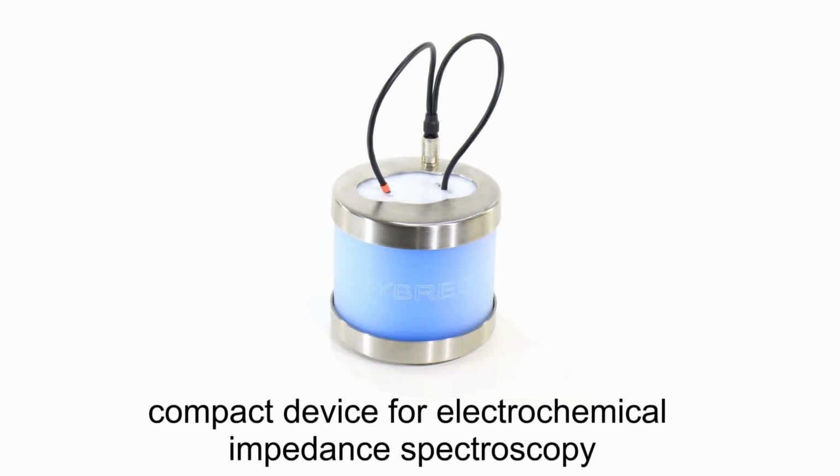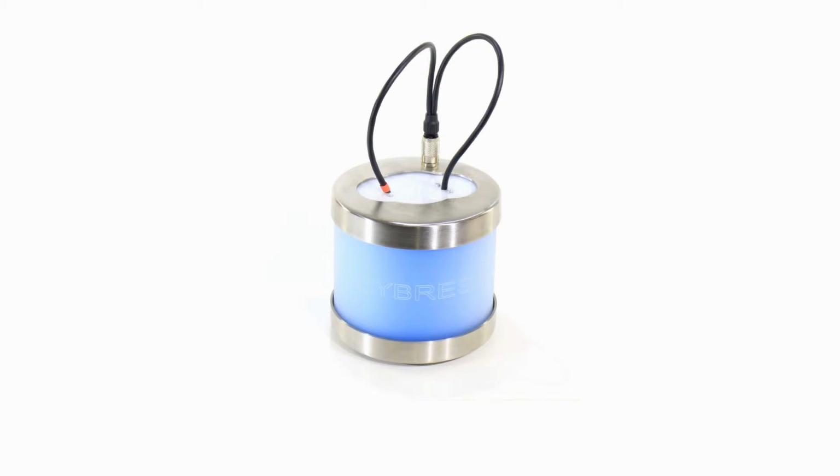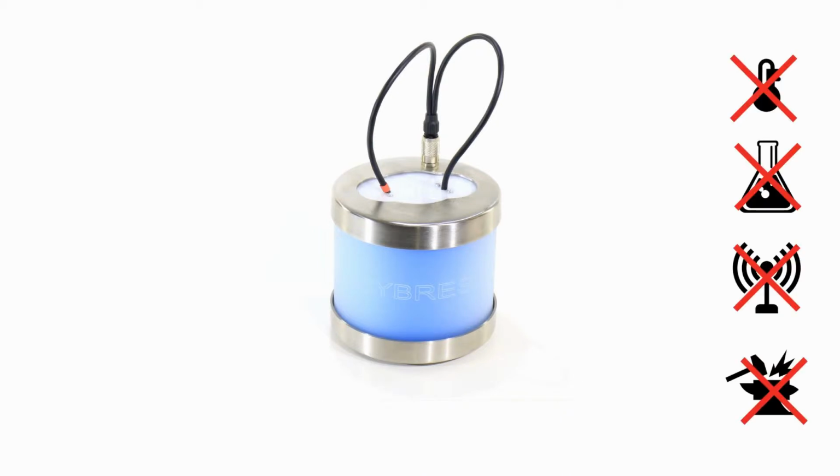This compact device performs electrochemical impedance spectroscopy. The system maintains stable temperature of electronic components and fluidic samples. The measurement eliminates the influence of temperature, chemical contaminations, electromagnetic emissions, and mechanical distortions.